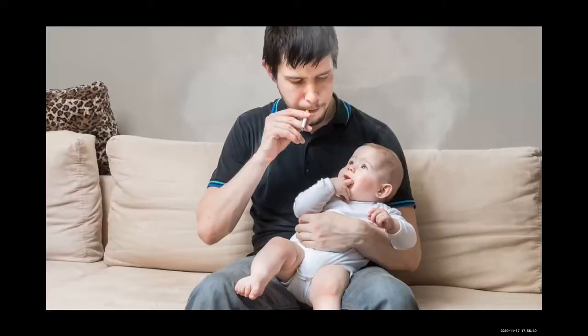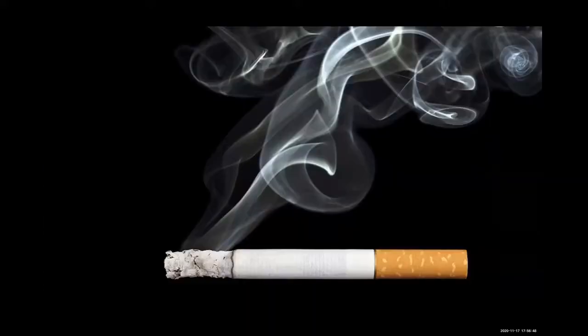This laboratory investigation focuses on studying the smoke inhaled by smokers as well as side stream smoke. You will use a simple apparatus to simulate the smoking process and will collect, weigh, and observe the solid particles produced by burning a cigarette. This will allow you better insight into the quantity and nature of the solids in cigarette smoke.